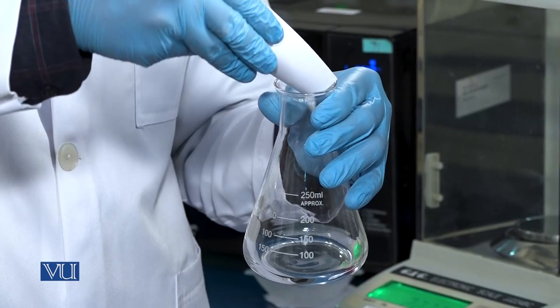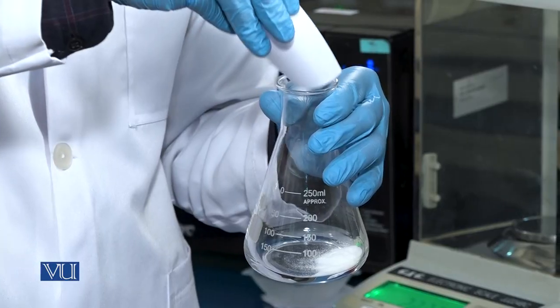After weighing, agarose powder will be added to the conical flask.